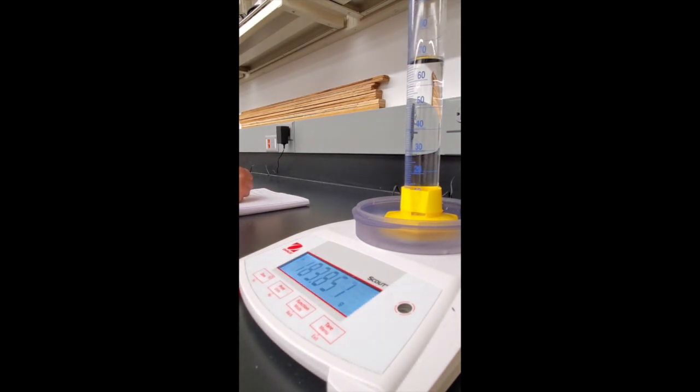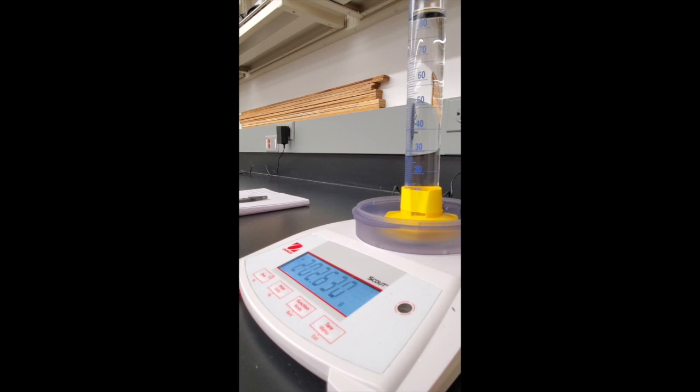More of solution A is added for our final measurement. The final volume is 87.0 milliliters and the final mass is 202.630 grams.